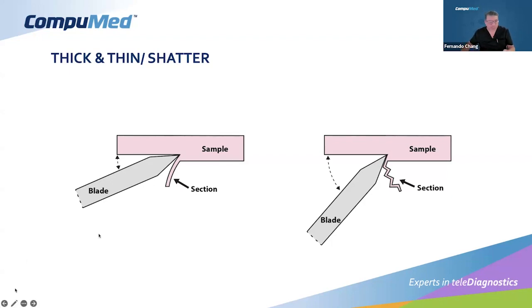And then you can see in this part, the blade, this is a more obtuse angle. This is 5 degrees. This is 5 degrees. We would like to have 5 degrees as a standard. And at the moment is sectioning the sample.